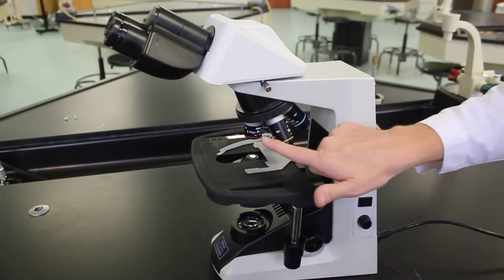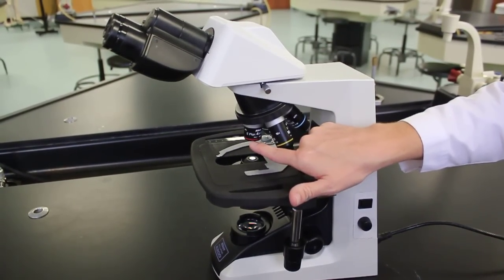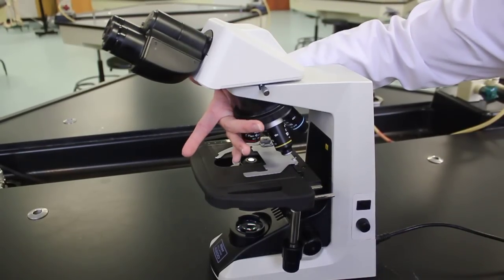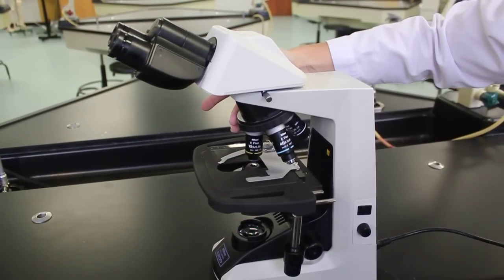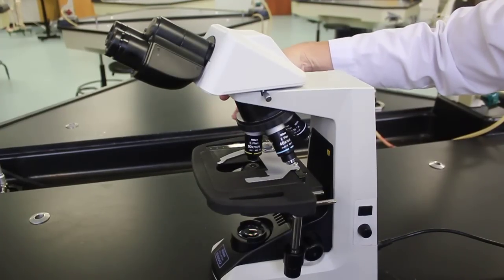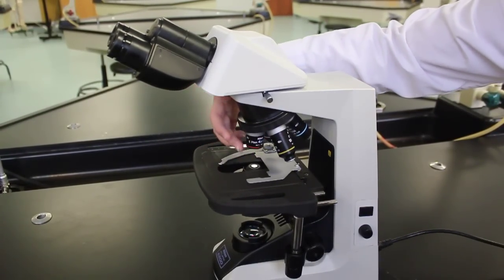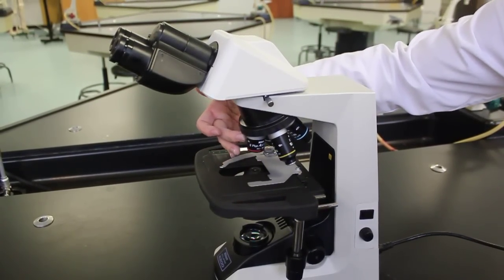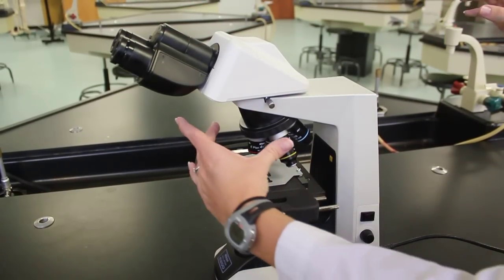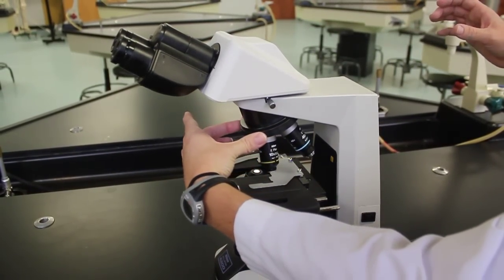When focusing the microscope, you always start with the scanning or 4x objective, switch to the 10. Notice as I switched between objectives, I did not grab the objective to turn. You turn by grabbing the nose piece itself.